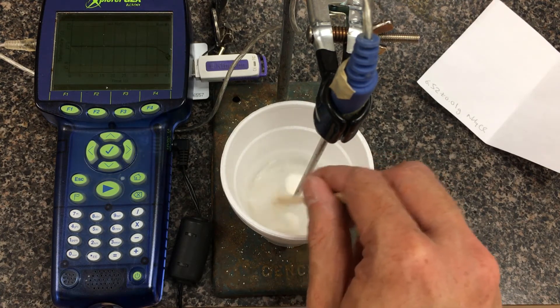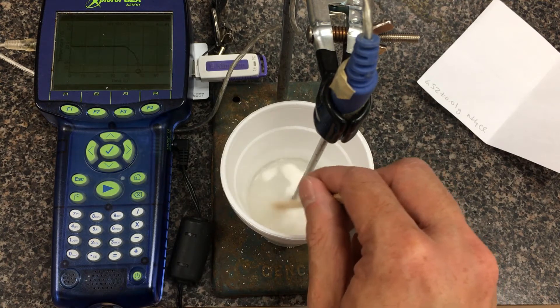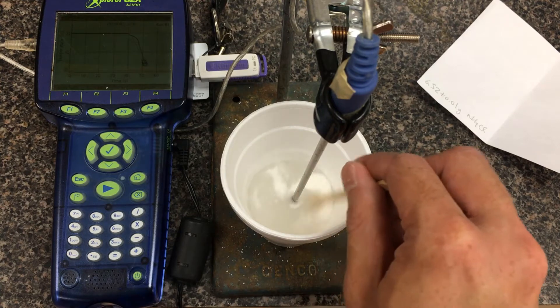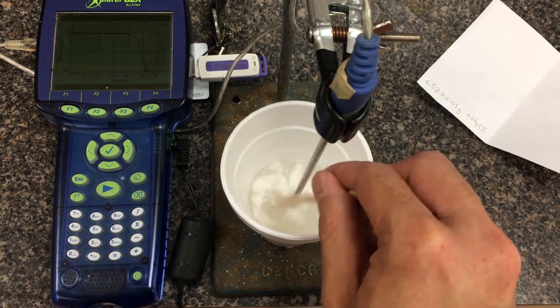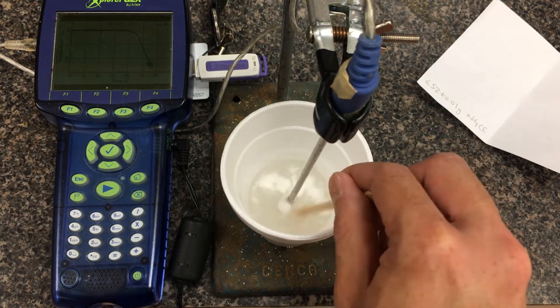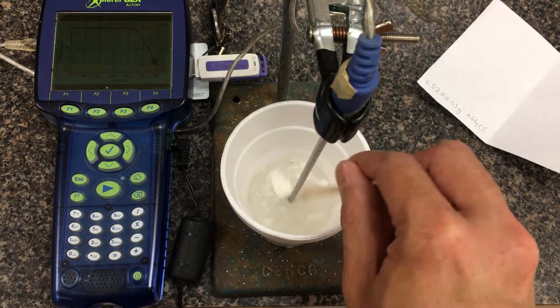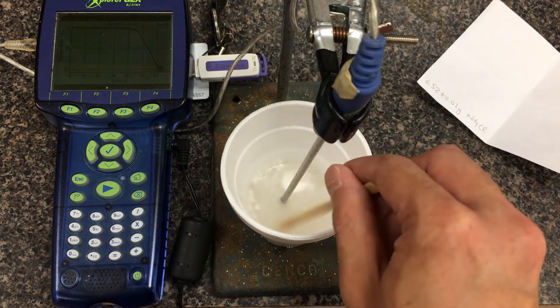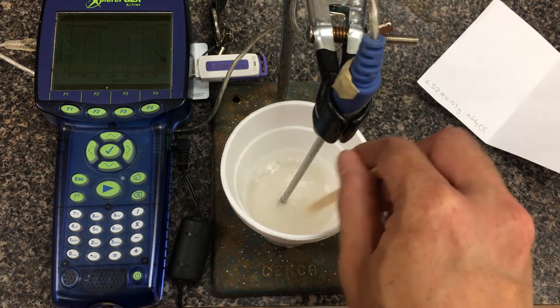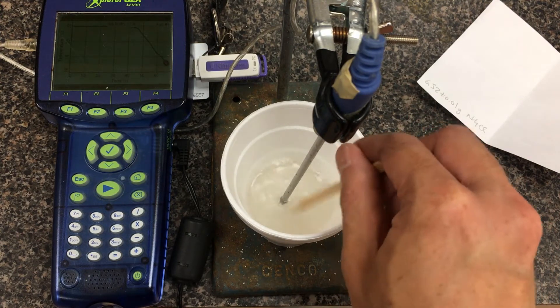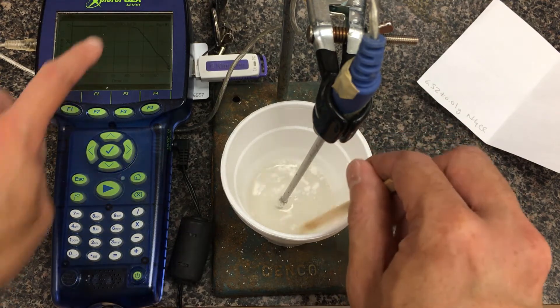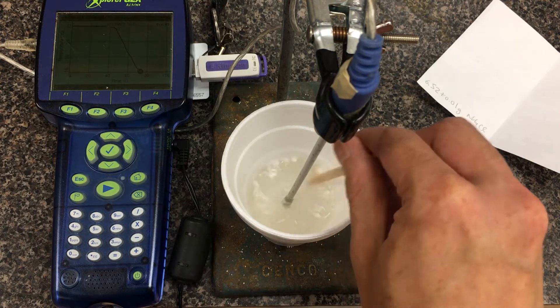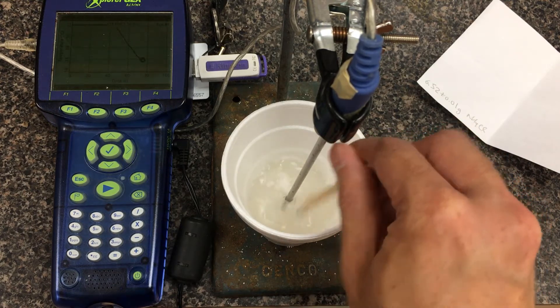Do a little bit of dissolving. With the first trial, ammonium chloride is endothermic. That's why you see that the solution is dissolving. If you make some qualitative observations in this styrofoam cup, you'll notice some of the powder is sitting at the top. Sometimes if you don't have consistent stirring or the powder dissolves in chunks, you'll get little blips on the graph. We're going to minimize those by mixing the solution as the reaction occurs.